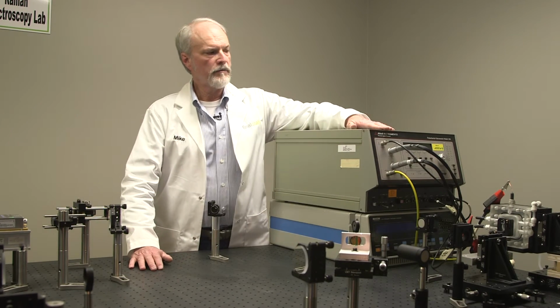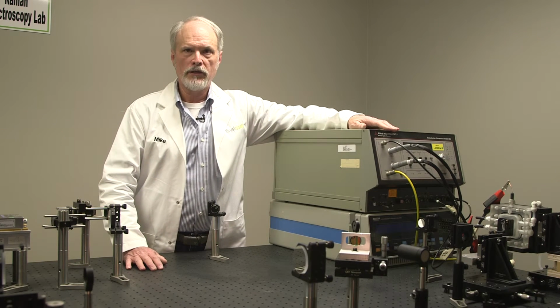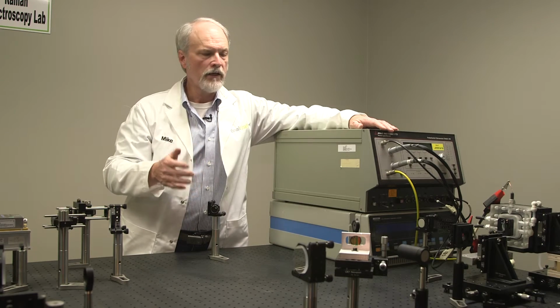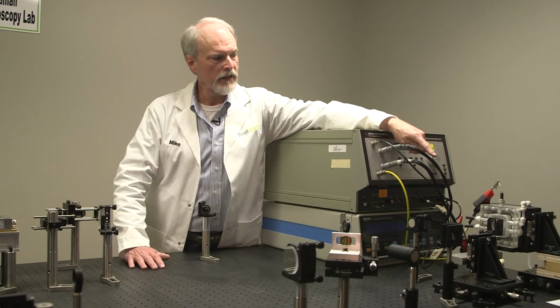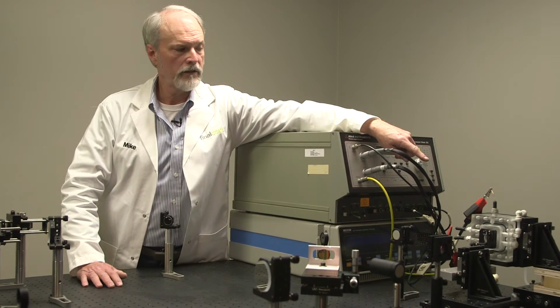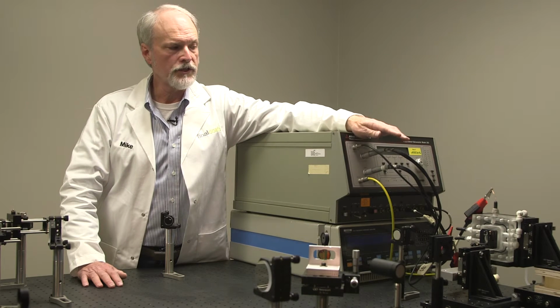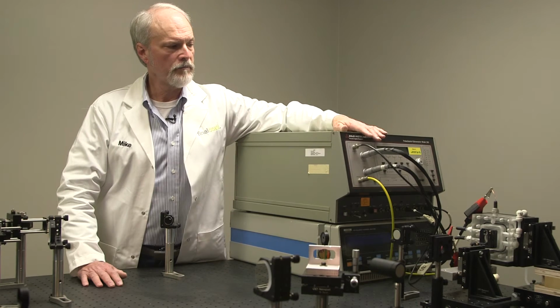Now, the other thing that we want to do in here is we want to control the growth of, say, a zinc oxide layer and then study it with Raman spectroscopy. And the way that we do that is we use a potentiostat. Now, this potentiostat then is connected to a corrosion cell, which is that clear acrylic block. And so we can very precisely control the corrosion conditions of the sample in the corrosion cell with the potentiostat.